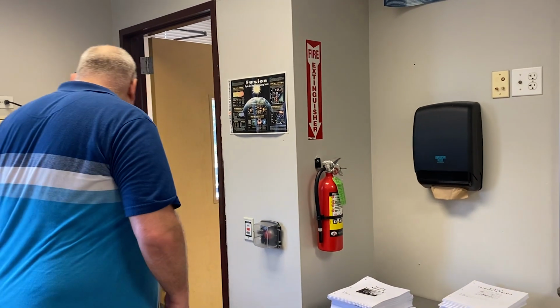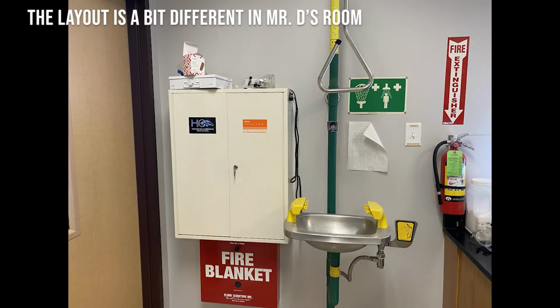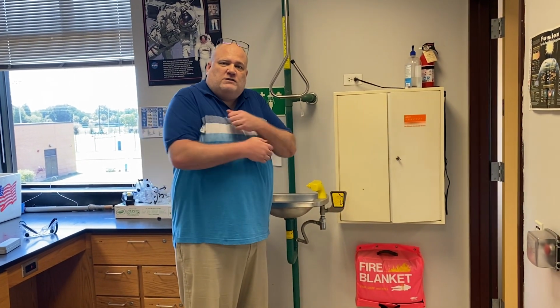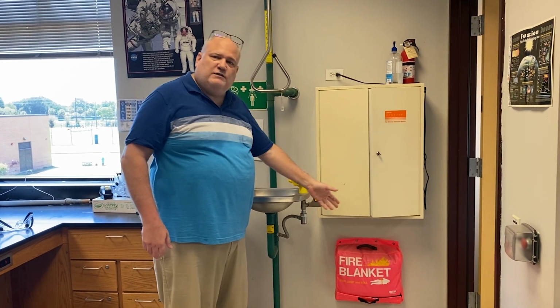Similarly, there's going to be a fire blanket right here, and you guys have probably all heard of the stop, drop, and roll. The worst thing you can do is run around the room fanning oxygen into a flame. So if something happens, we're going to have you smother the fire as quickly as possible with the fire blanket.